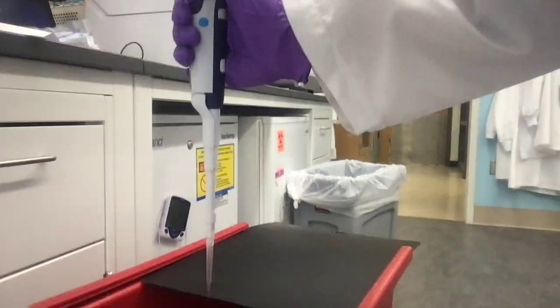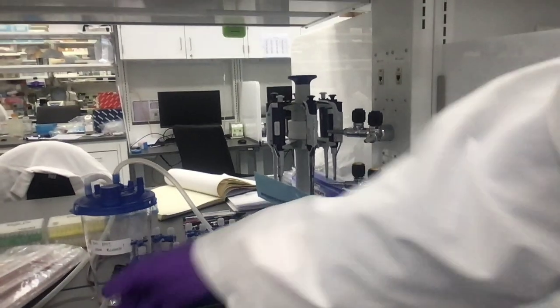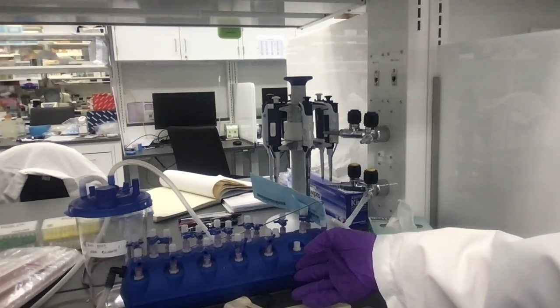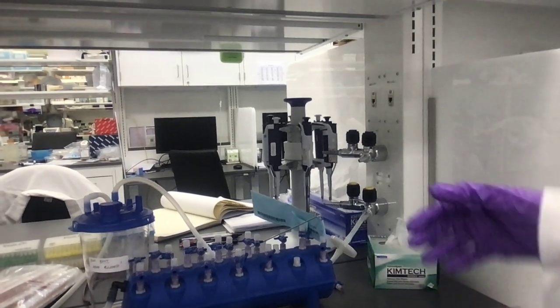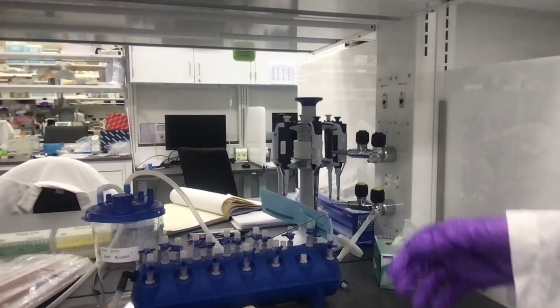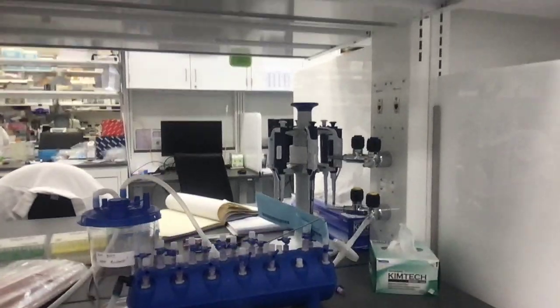There are red bins around the lab that are used for disposing of biohazard, and that's where we get rid of most trash that we work with. There's this device here that looks sort of odd. It's connected to a vacuum, and it sucks air. If we're doing a DNA extraction protocol, for example, we'll often add a lot of reagents that help get rid of proteins that might chew up the DNA, and we want to suck out that solution. We use a device like this for that.